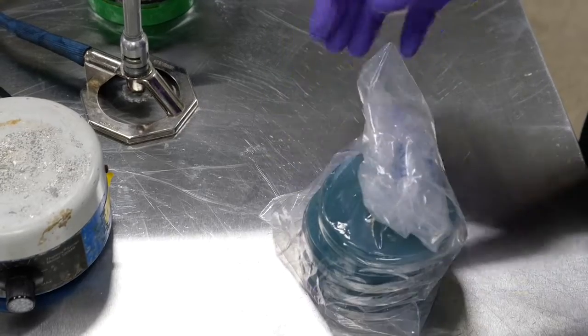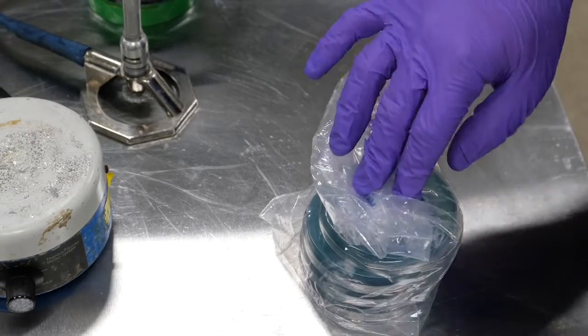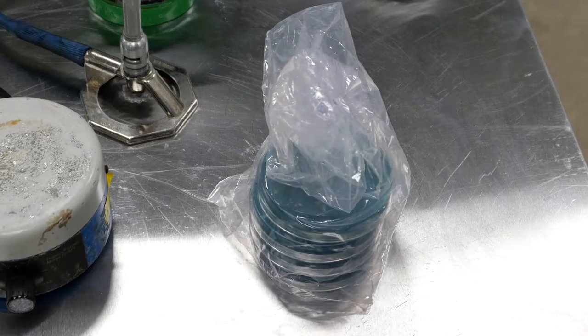And then we just want to seal it up and we're good to go. That is your own homemade agar plates.